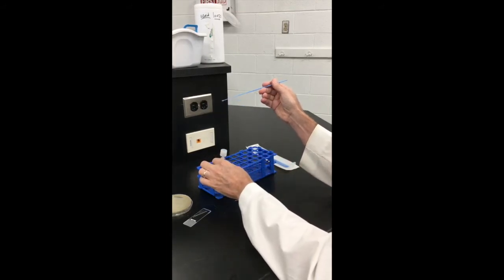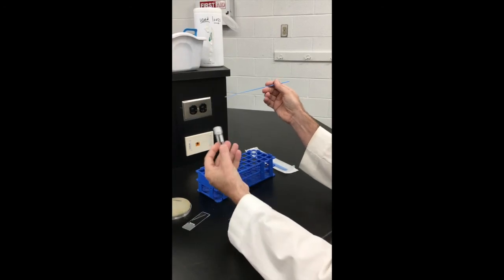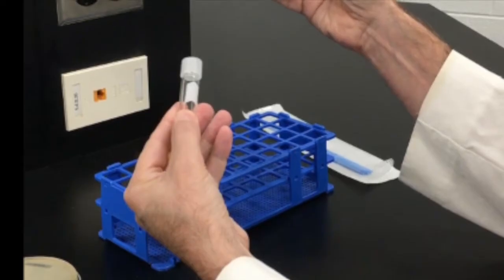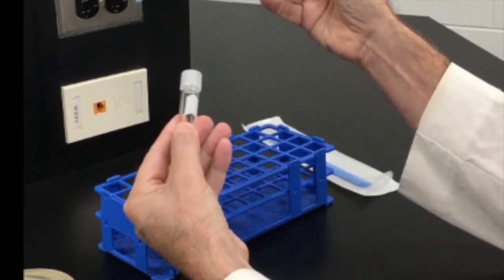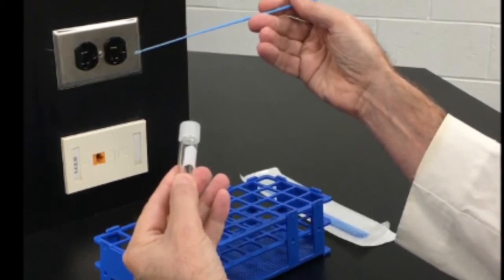First, hold your tube securely in the palm of your hand at a comfortable angle. Holding the tube at an angle minimizes the size of the tube opening as seen from above, the direction that microbes in the air would drift from.